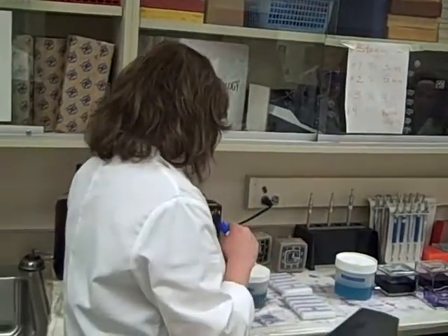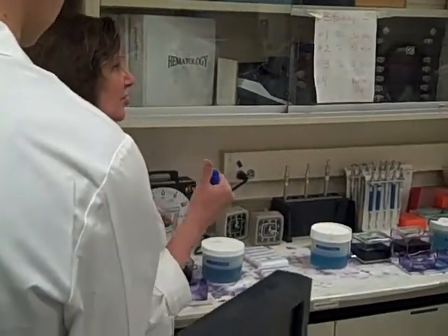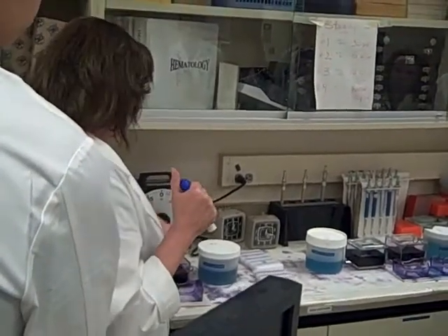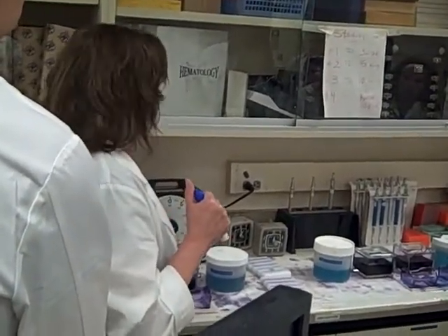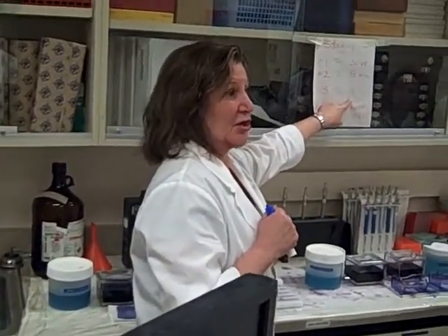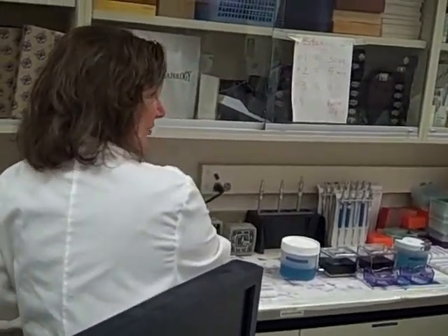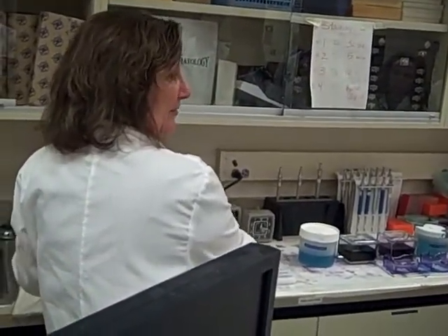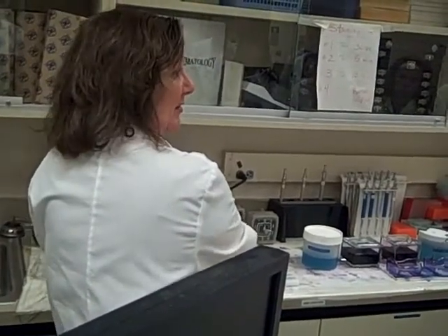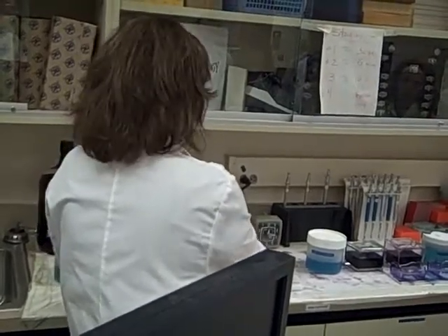And if you look at it, it's got kind of a nice green scum on the top of it — that means it's good. The right pH will give us good, nice color. That one is our rate-limiting step because it's 10 minutes. So don't get backed up. Don't start staining right after the person in front of you because that's going to be the step that messes you up. That has to stay in there a full 10 minutes.